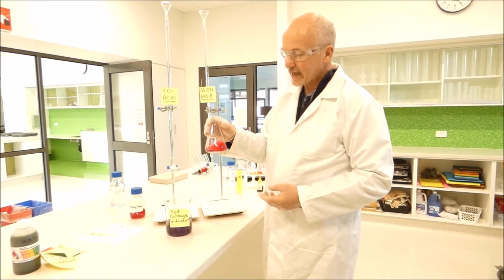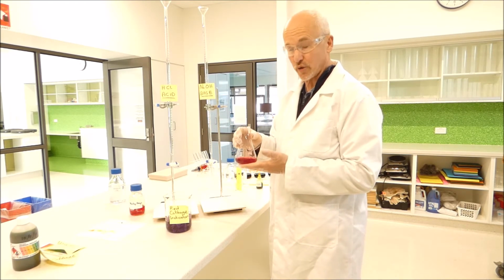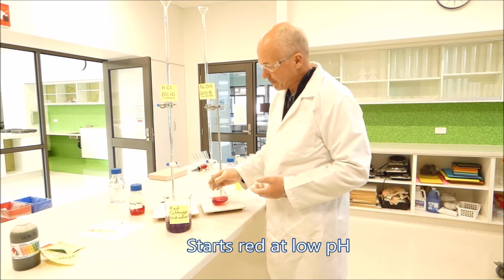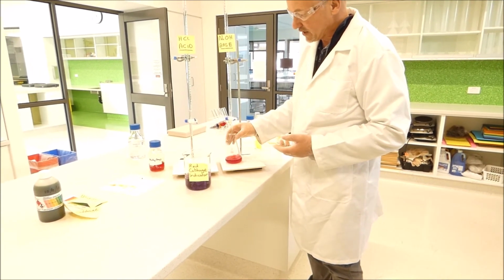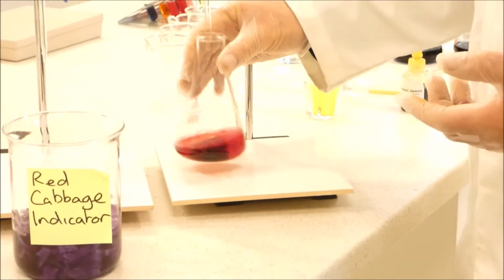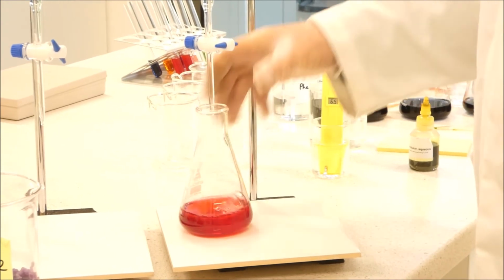Alright, so our second indicator was the red cabbage indicator. Now we've acidified this solution with some hydrochloric acid already, so it's a nice bright sort of red colour. We'll put it under our burette with the 0.5 molar sodium hydroxide, so we can add hydroxide ions in there to slowly make it more and more basic. So we'll add a little bit of sodium hydroxide and we'll see what colour changes we observe.